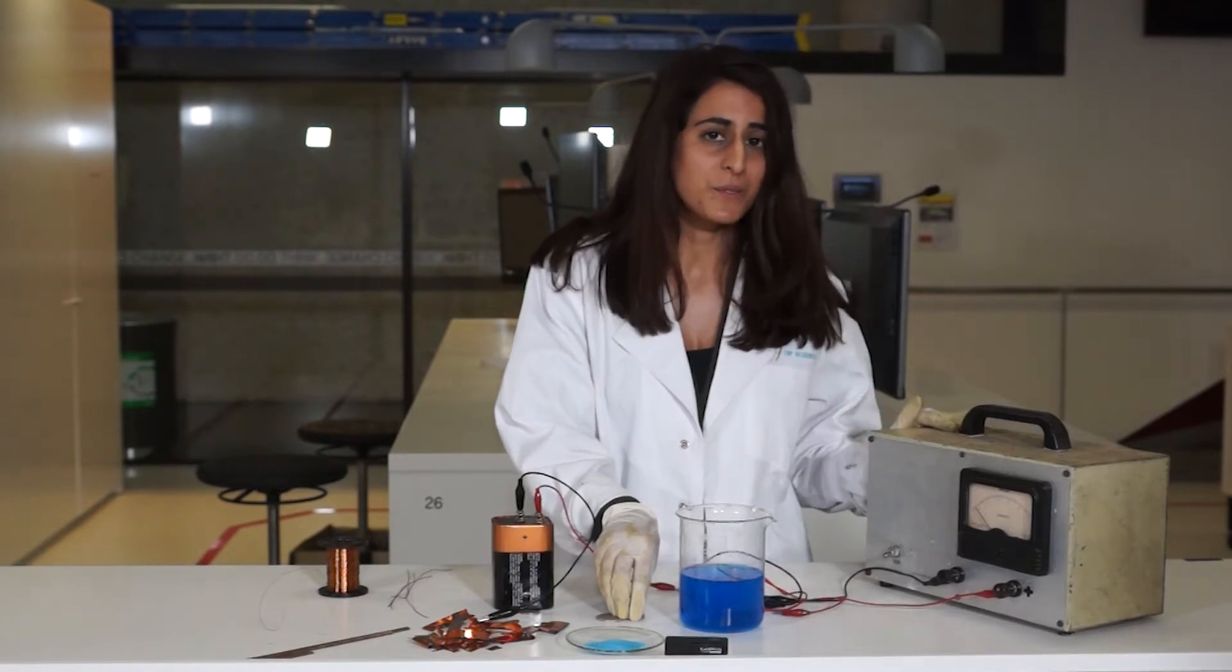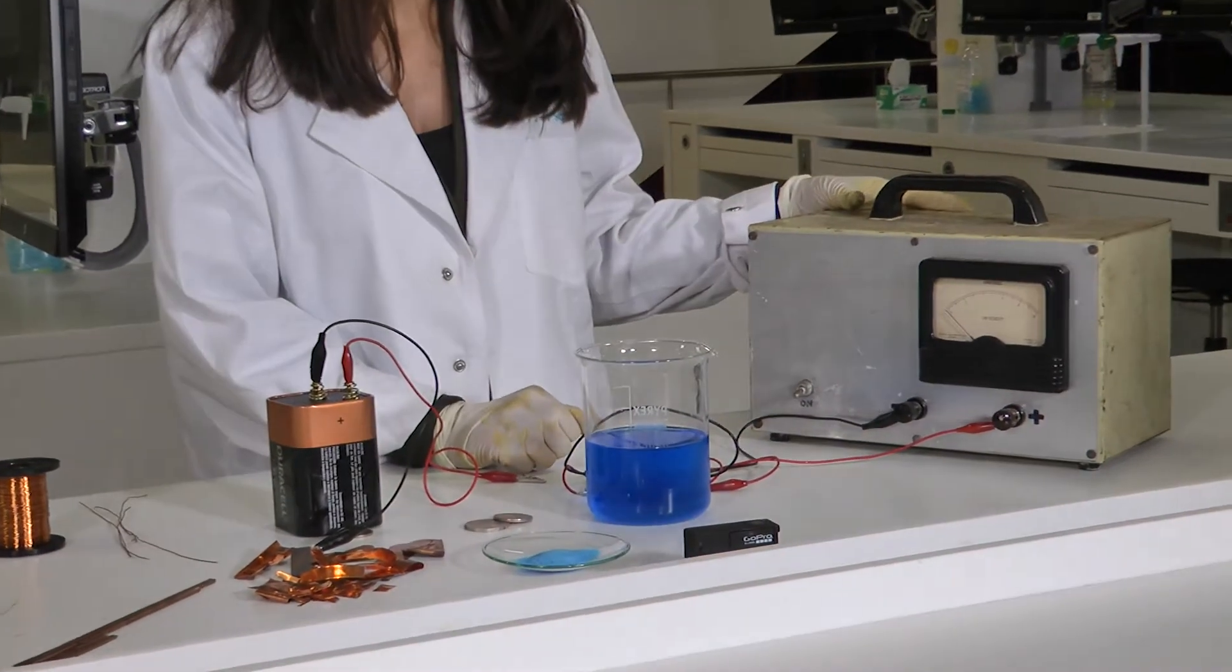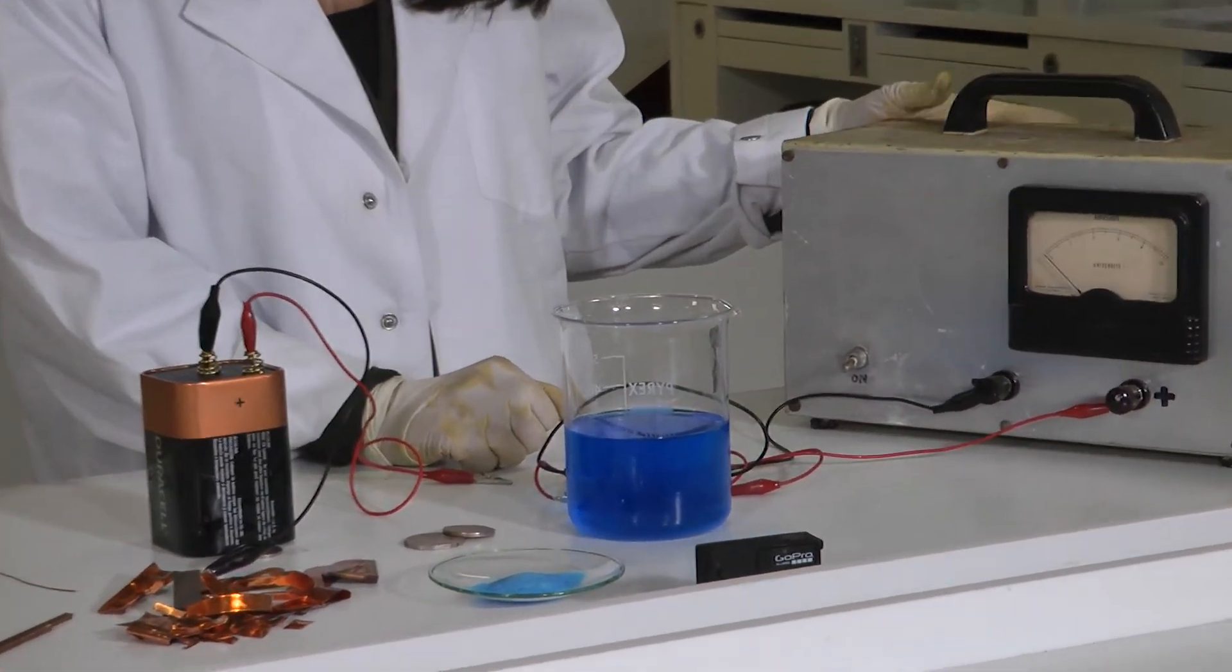First we need a power source. We're going to use this rectifier here. It's just an old battery charger that we had lying around.